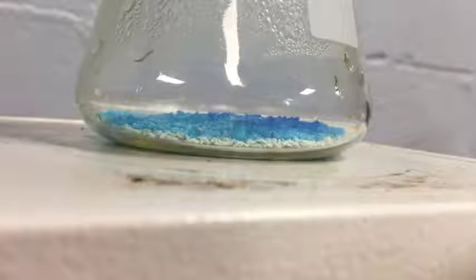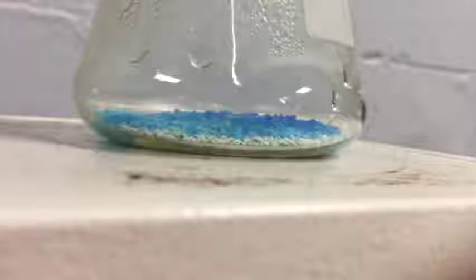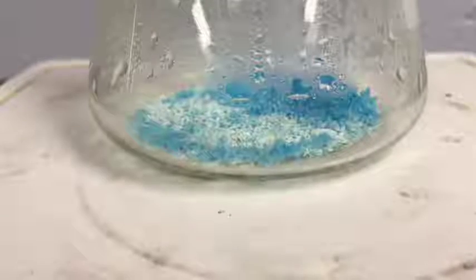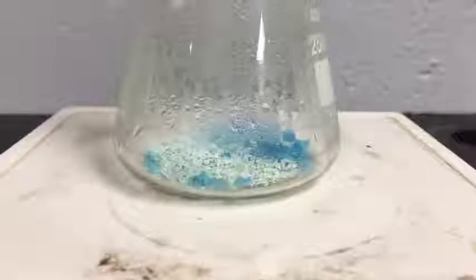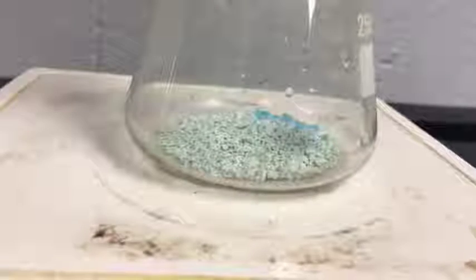Our last step will be to subtract this mass, which is the anhydrous, from the original mass of the compound. And this will give us the amount of water that was lost during the reaction. So for the hydrous mass, we're going to do 120.729 minus the anhydrous. And so here you can see a board where I have the final mass written, and our equation discovers that we have lost 2.619 grams of H2O. You can look at our equation on the picture of the board here, and you've completed your experiment, and I hope that was helpful.